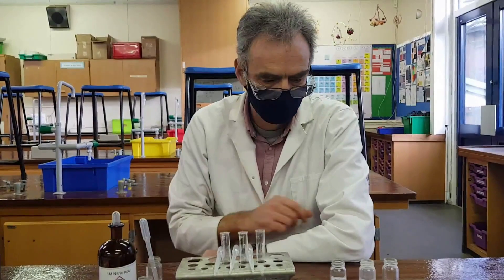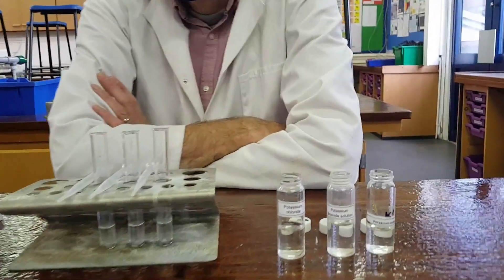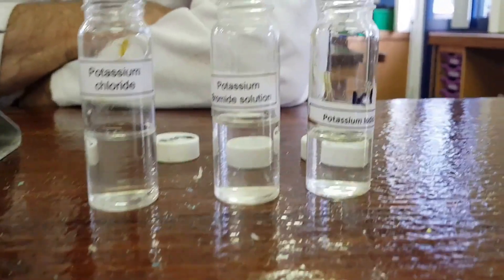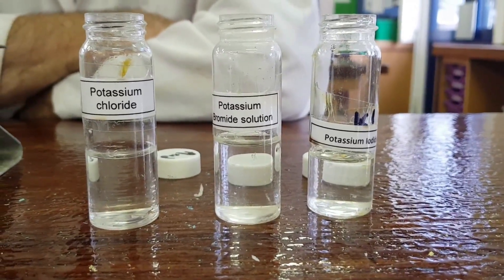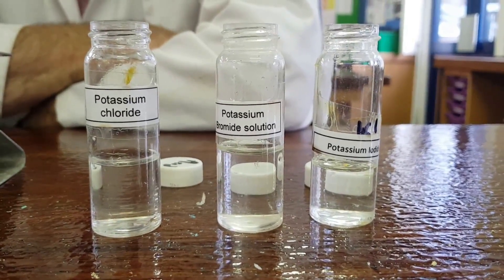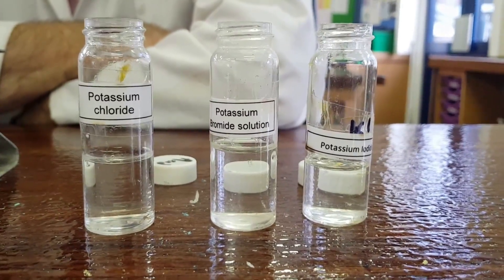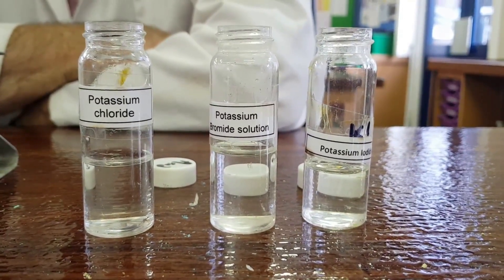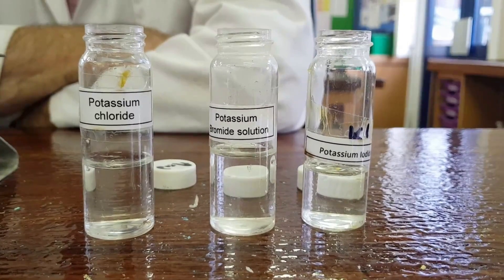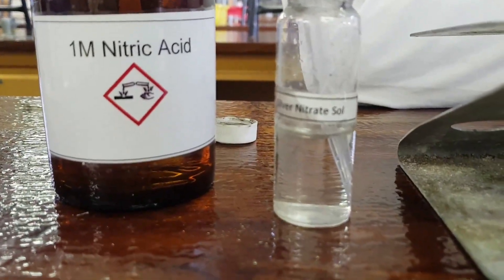In this video we're looking at identifying anions — the negative parts of a salt. We have three solutions: potassium chloride, potassium bromide, and potassium iodide. Because they all contain potassium, any differences will be due to the negative part of the salt — the halide: chloride, bromide, and iodide. We're going to test these using silver nitrate solution.